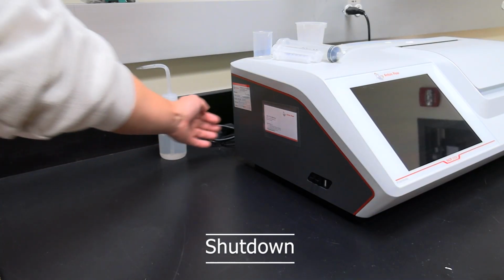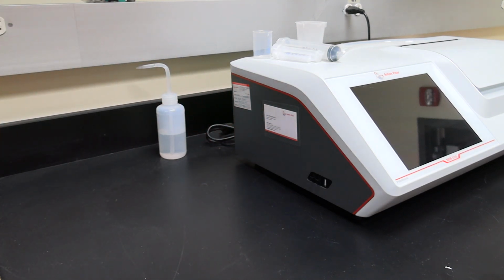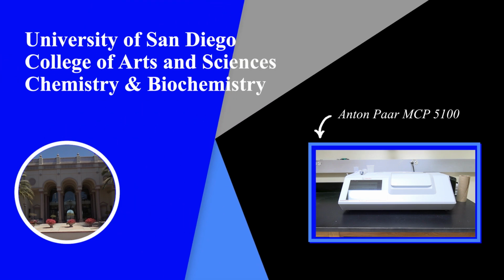Shutdown. Flip the power switch on the back of the instrument. The display will turn off. Place the polarimeter supplies back on top of the instrument. The instrument SOP should be located next to the instrument. If assistance is needed, please look in the instrument SOP for the contact information of the scientific instrument specialist.